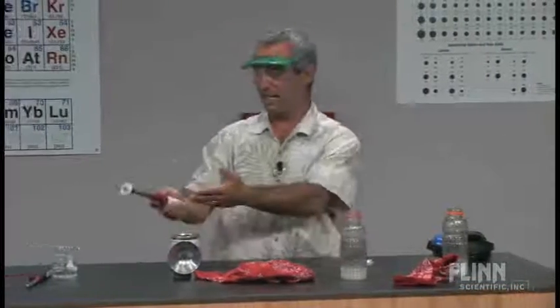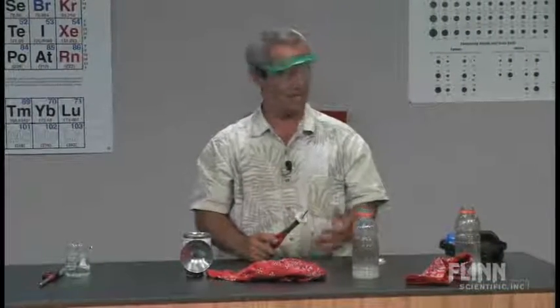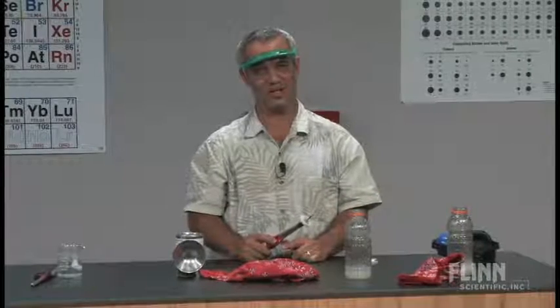I want to prove that there was, in fact, acetylene in there — but there was too much. So if a little is good, more is better? Not in this case. A nice illustration of combustion, of a reaction that produces a gas, of kinetics. A lot of chemistry in this one.